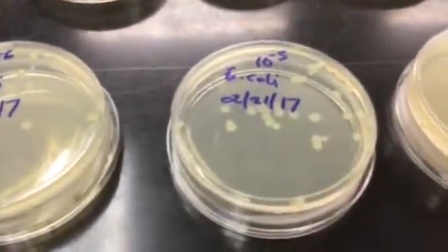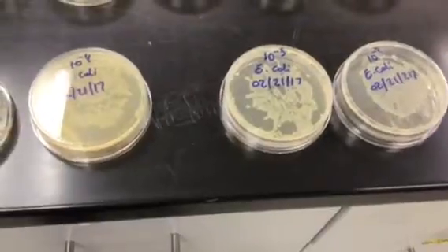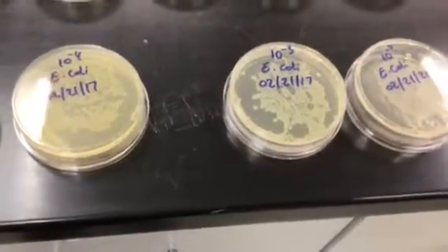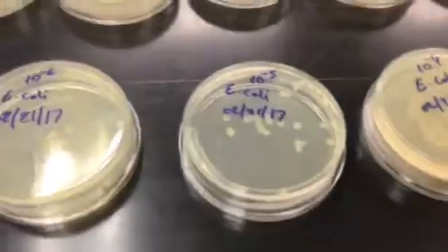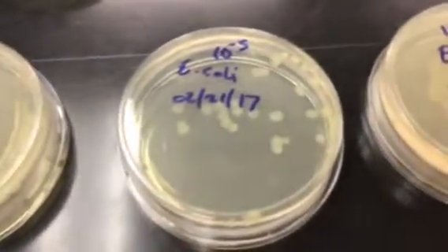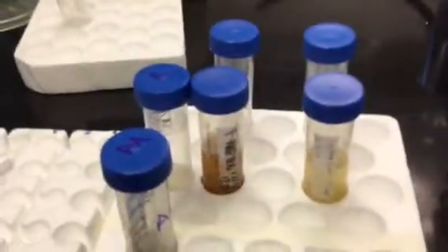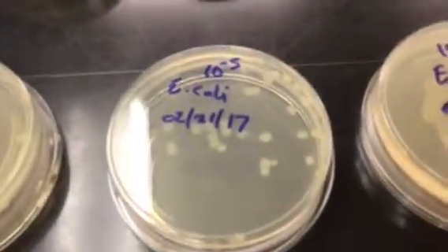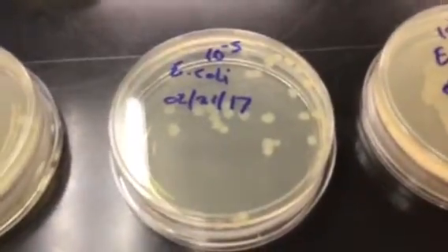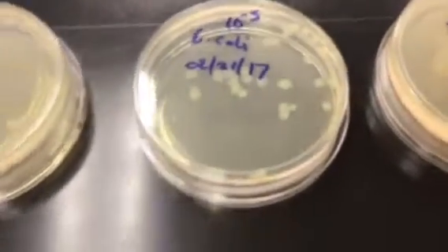And so we used a typical 10-fold dilution series, and to do that, we used 1.5 microcentrifuge tubes to make our dilutions. And so he labeled them as 10 to the -5, and that means that's the 5th dilution down. But actually, since we took 0.1 of this original concentration here and started our dilutions from that, this 10 to the -5 here is actually, when you calculate it out, going to be 10 to the -6. So that's just the way we notated our dilutions.